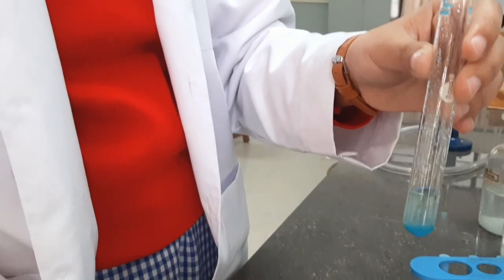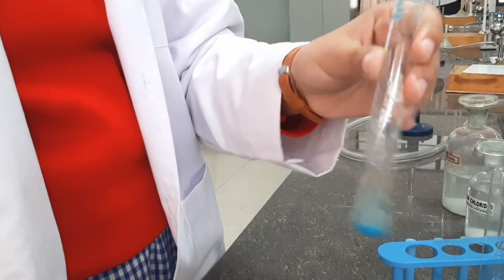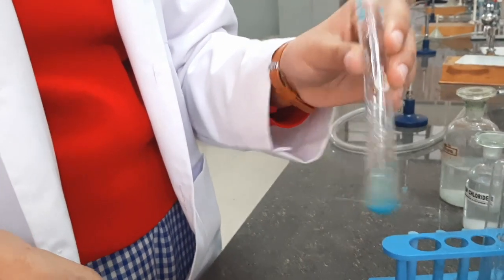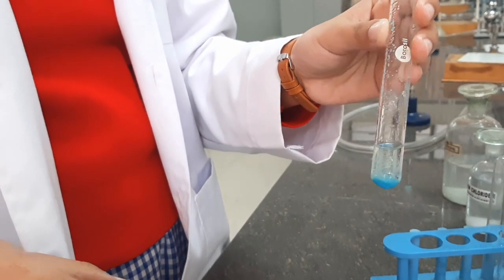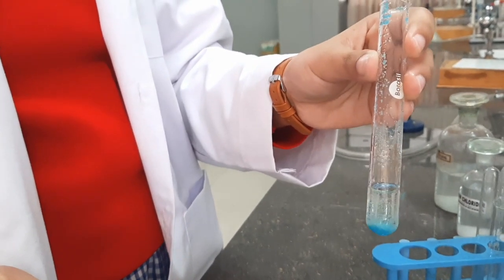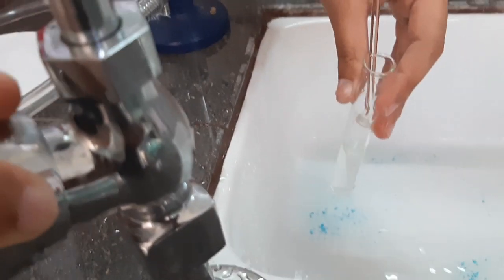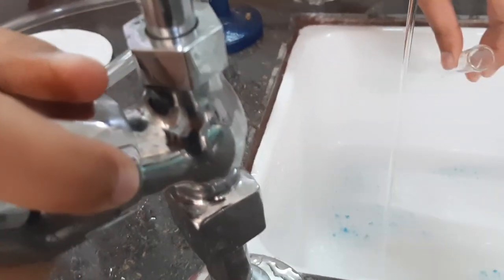No observation — you can even warm and check. No observation shows absence of concentrated acid group radicals such as nitrate, bromide, iodide, etc. Whenever you discard anything into the sink, it is very important that you run water.